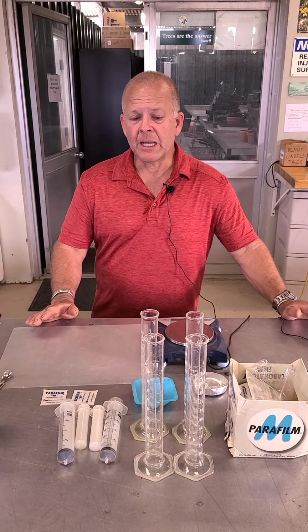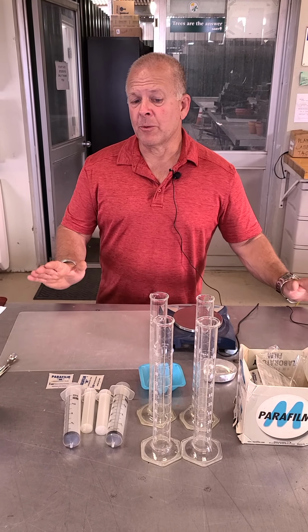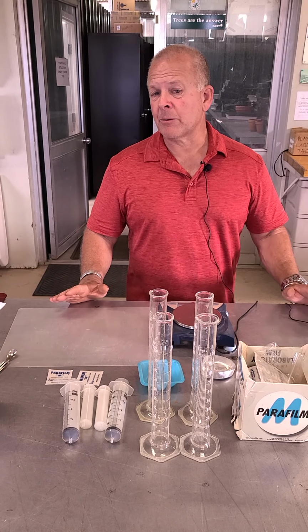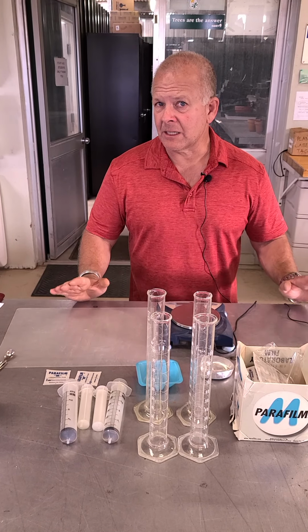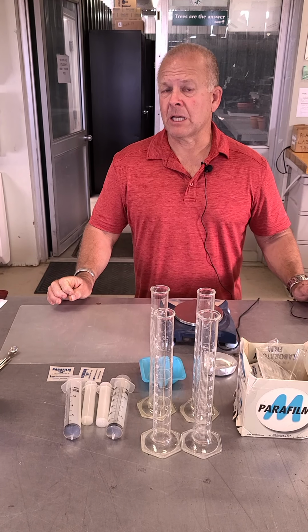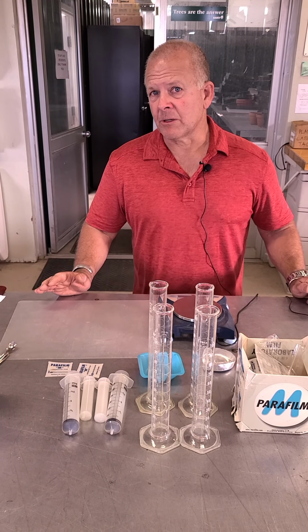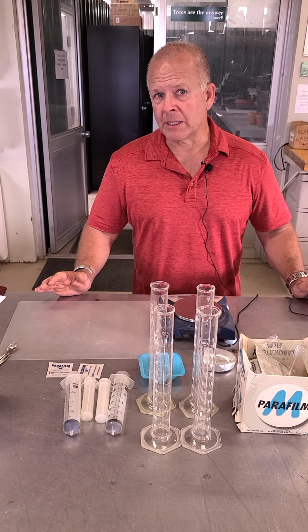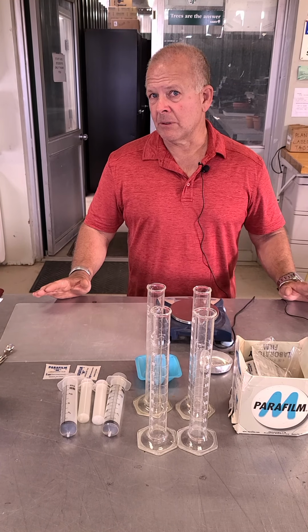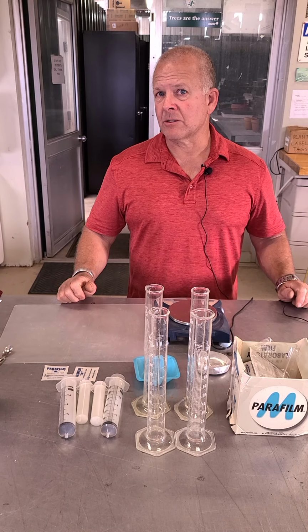This is just going to be the procedure, but I'll give you a little bit of background so you understand what exactly we're doing. So particle density, you might have heard of particle density and bulk density together. They're both similar, yet slightly different. What we're looking at with particle density is the actual density of just the particles in the soil. And if you'll remember from lecture, lab, and me yakking constantly about it, the particles in the soil are sand, silt, and clay. So what we want to know is, what is the density, or what is the displacement, if you will, which is going to give us the density of the sand, silt, and clay particles in our soil sample.